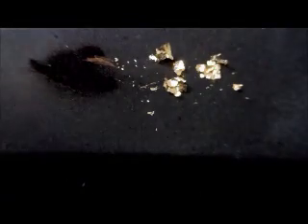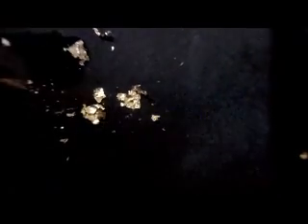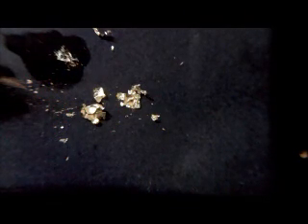Maybe it's less gold than 14k, so I'll try the 10 karat gold. But the only sample I had rubbed on the stone is eaten away, so I'll just try it on the loose foil. Let's put some 10 karat acid down here and see what happens. I got the spot of acid there and I make sure the foil is covered by using my plastic pen. You can see the acid working at it and eating it up, but it's not disappearing as quick as the 14k. So there must be some sort of gold in here.